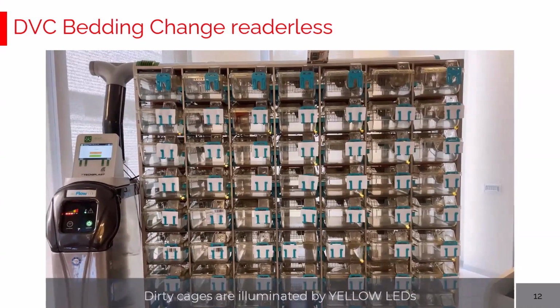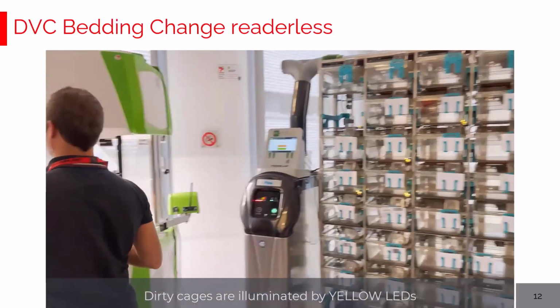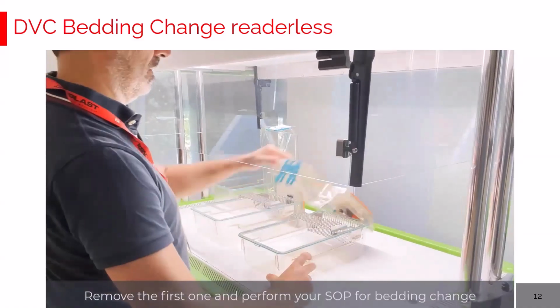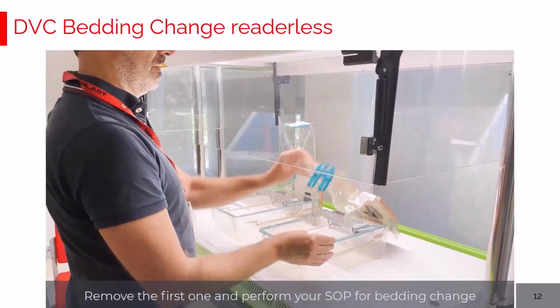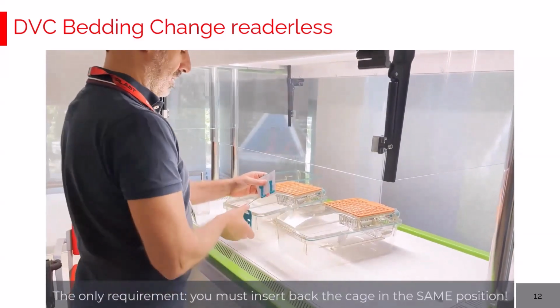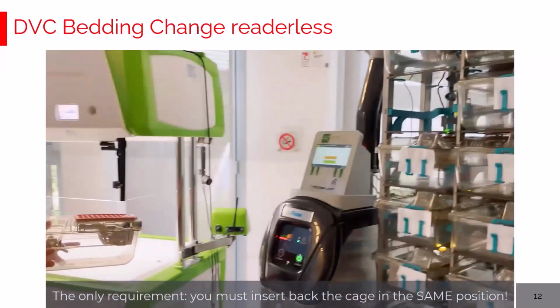These are illuminated by yellow LED lights, and the operator can start from any of these cages, simply performing a standard bedding change as performed today. So opening the dirty, moving the animals to the clean, closing the cage top, moving the card label.